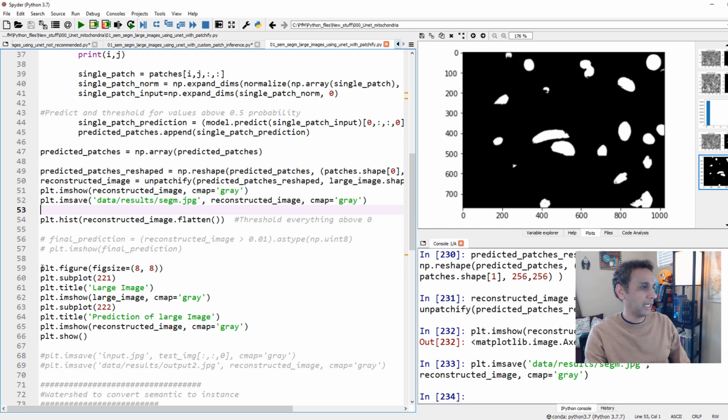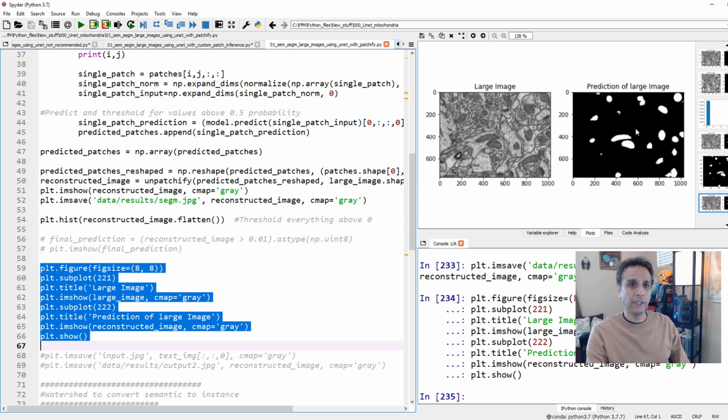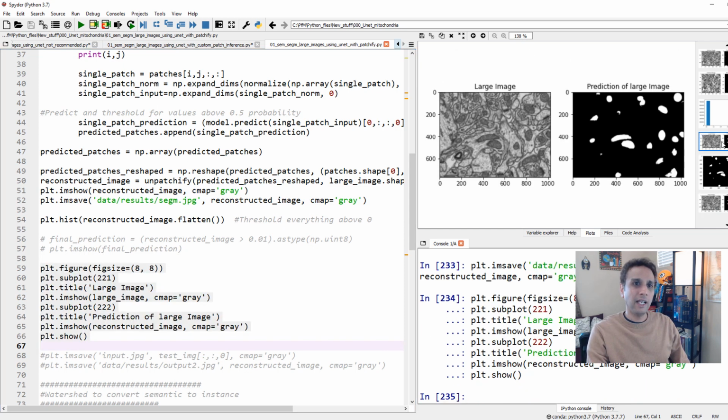Let's actually look at the images. And there you go. And if you look at this and the other one, this image that you're seeing right now on the screen is where I have written my own for loop to handle the patches. And here, it's Patchify. The result is identical. There's no reason for it not to be, because I'm just extracting 256 by 256 patches and applying exactly the same trained model. So the result should be identical, obviously.